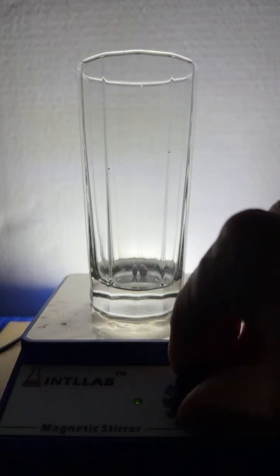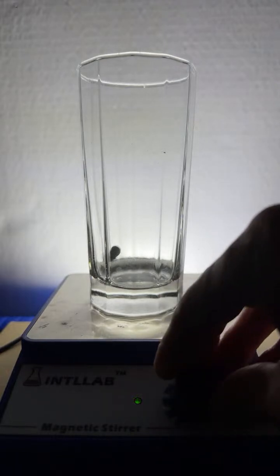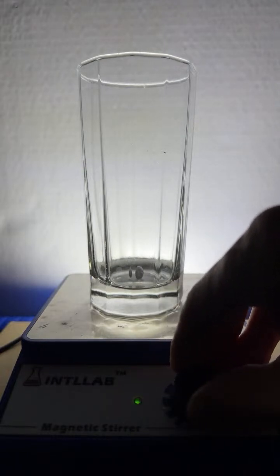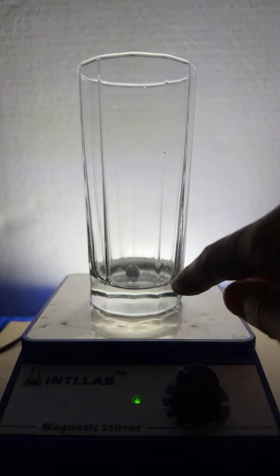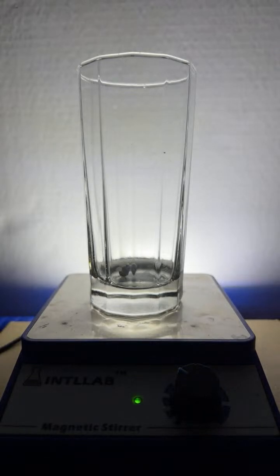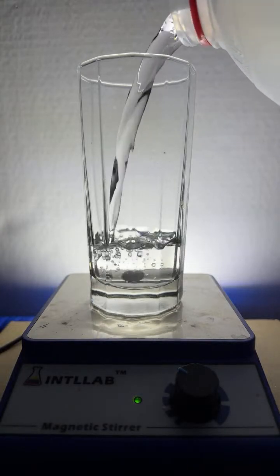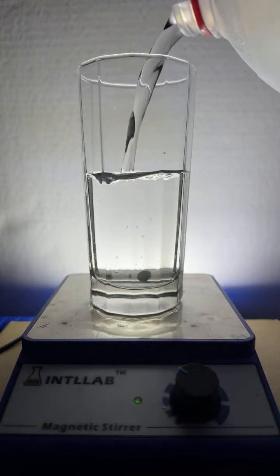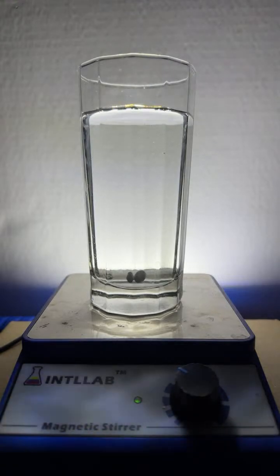All right, here we go. I got a little stir bar in there. That's going to be nice and tiny. That thing does not know what it wants to do. We're going to have to go a slow speed. You see the glass is tilted a little bit, which is going to mess things up just a bit. Maybe as I add the water, that may tone it down. Yeah, there we go. We got a nice easy flow there.